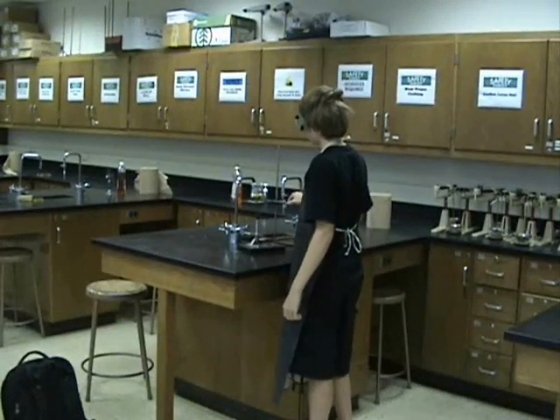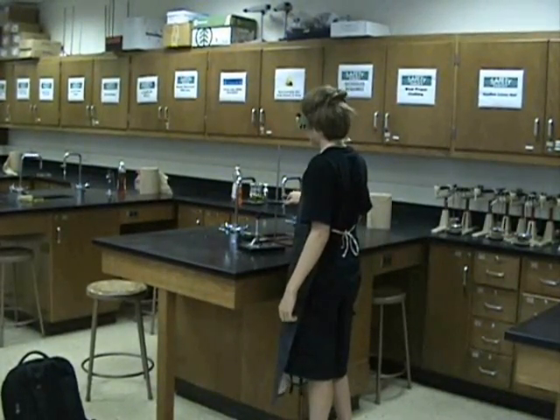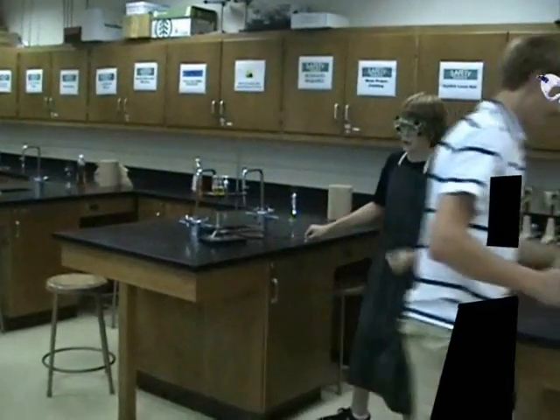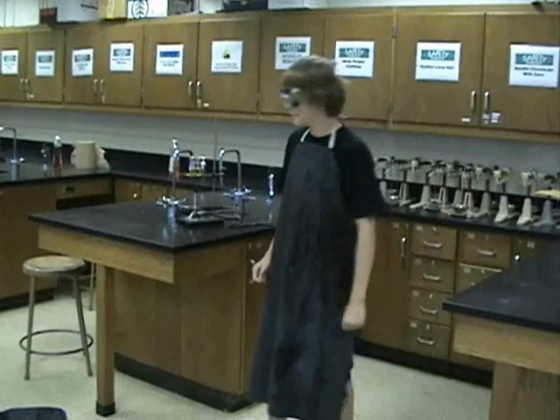Observe the same situation but with safety goggles on. No, wait! I have my safety goggles on! Safety goggles help protect the eyes from chemical splashes.